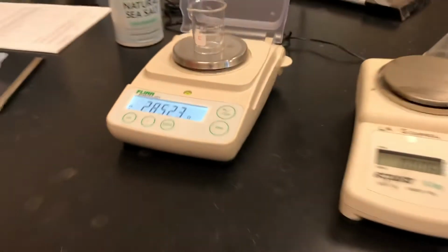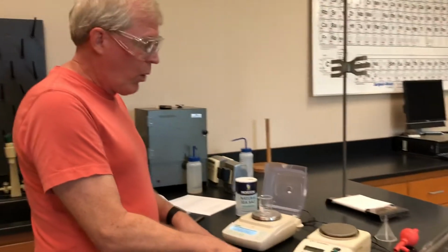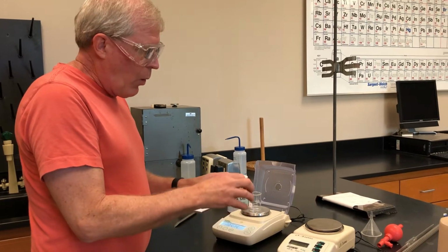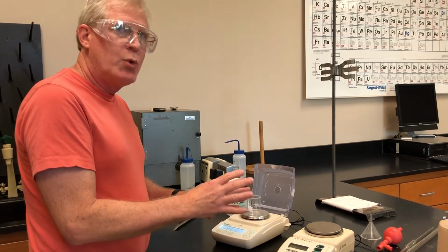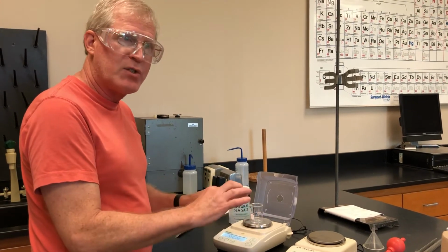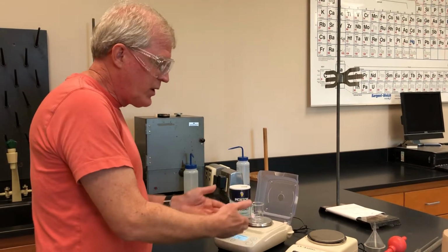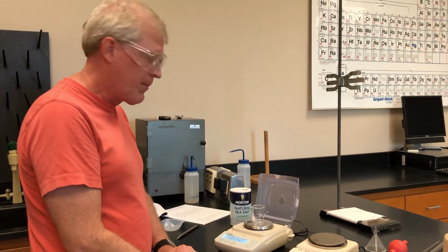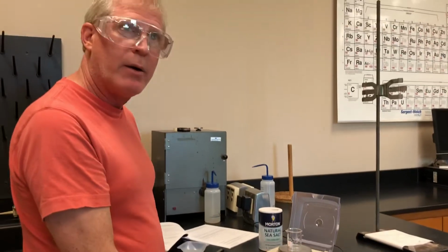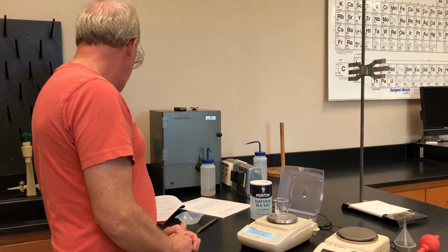And what you see is that the readings were pretty close to each other. But one rule I can say about weighing things is whatever electronic balance that you use, that is the one that you should stick with. You don't want any kind of small amounts of error encountered in your measurements because you switched to a different electronic balance, okay? So I'm going to use this really brand new nice balance right here just simply because it looks good.